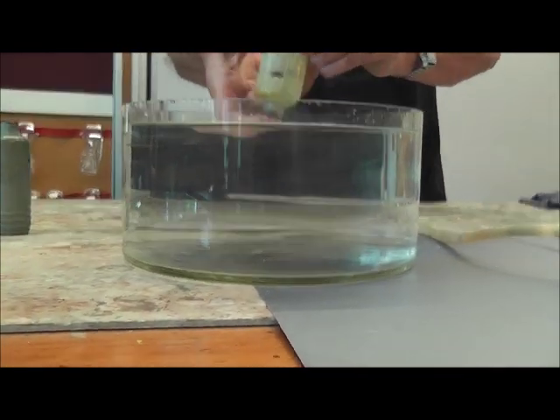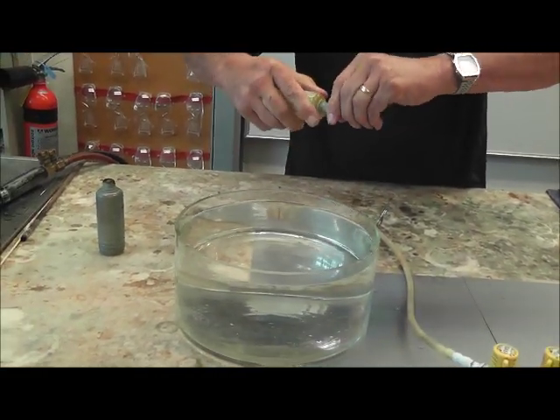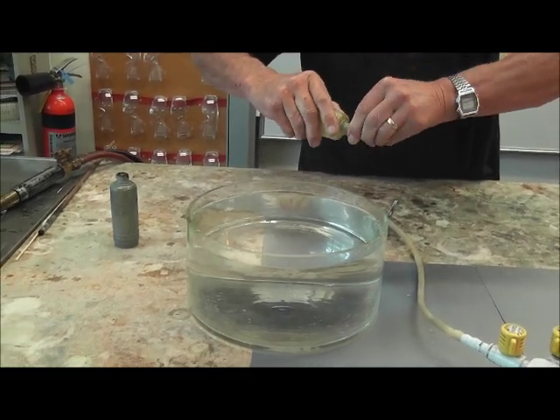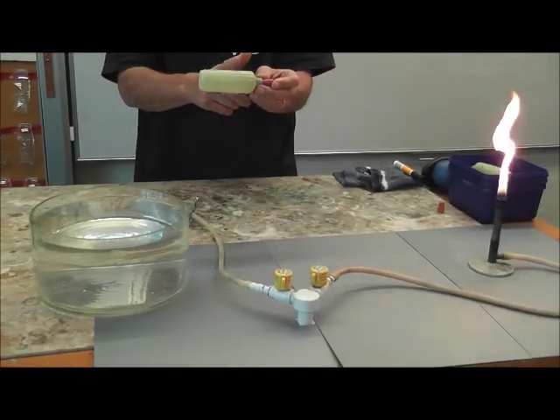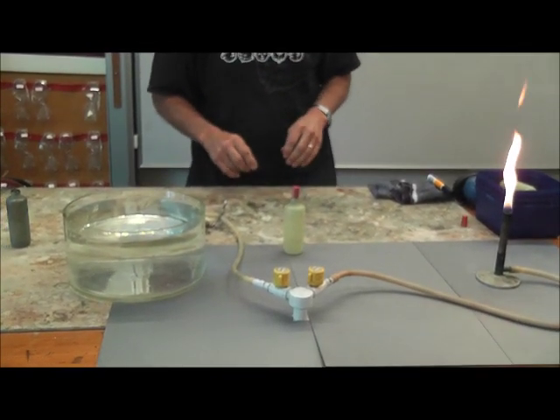So what we have now is this bottle in which we have propane and oxygen, about half of each. So we had about half propane, half oxygen. So we'll have a look at the combustion of that.